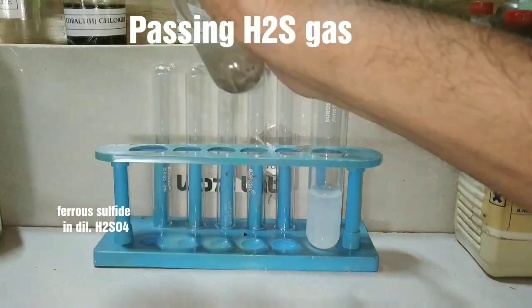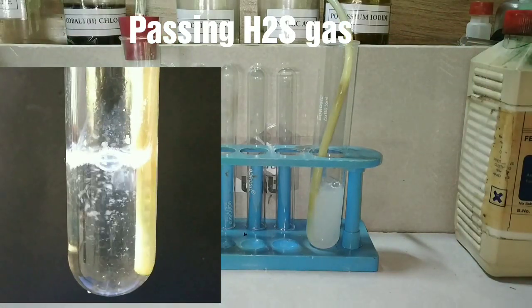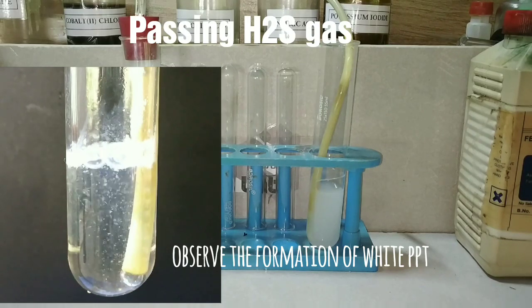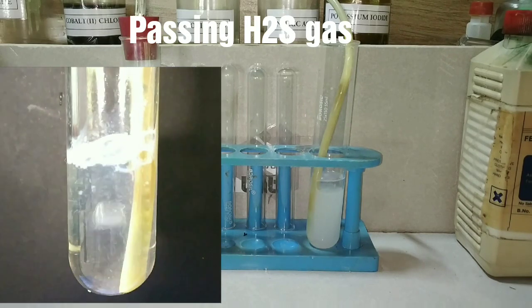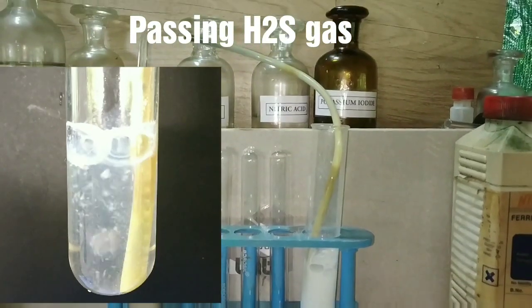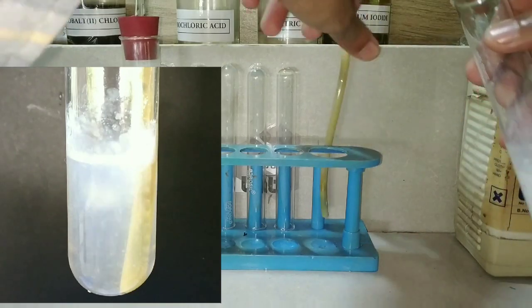Now we would be passing hydrogen sulfide gas through the salt solution. For practical purposes, students should always do the cation analysis starting from group 0. Hence, you should pass the hydrogen sulfide gas through the OS containing the group 3 reagent, that is ammonium hydroxide. Here, since we already know it is a zinc salt, we are taking the original solution and directly passing hydrogen sulfide gas. In your laboratory there must be a Kipp's apparatus; if not, you can prepare hydrogen sulfide by mixing ferrous sulfide with dilute sulfuric acid.